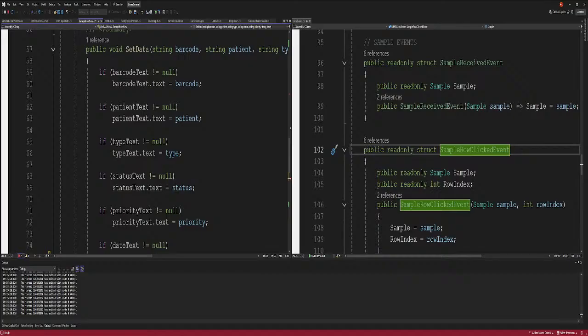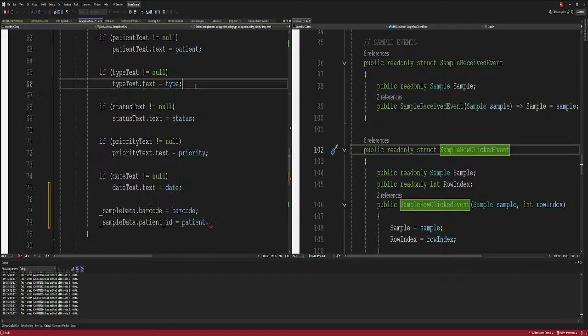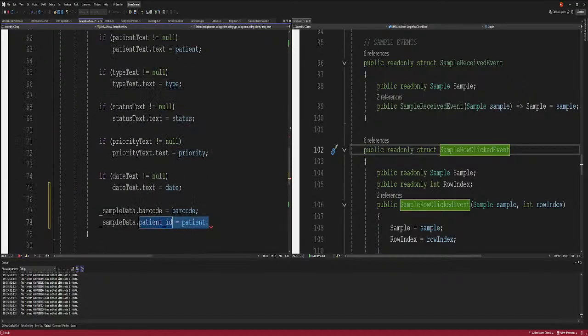What is a patient name? Oh, okay. There's no patient name. I guess it's just patient ID. I don't have patient ID here. Patient string status. No, we don't. Okay. We just have patient. So we'll just say patient name is patient. Well, now we really do need the ID, because we're going to need that ID to manipulate them in the database. But for right now, just for sample data, what's next?